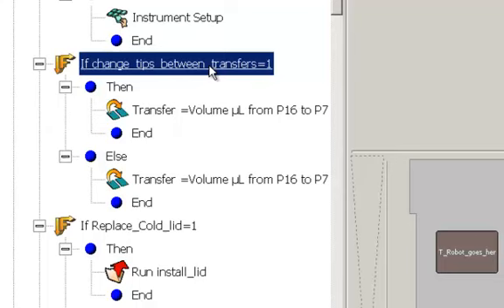The great thing is once you get this procedure set up to use the PCR plate or whatever plate you're going to use as your source plate, all the add reagents steps call the same procedure. There's only one place that you really need to modify and get working right so that you can transfer your reagents from your cold block or your 96 well cold block to your sample plate.